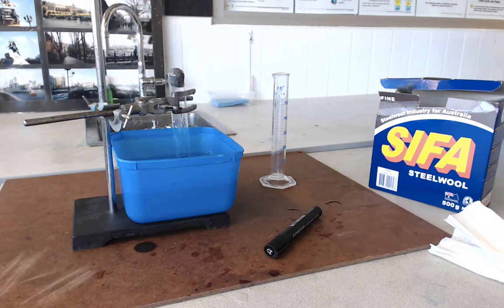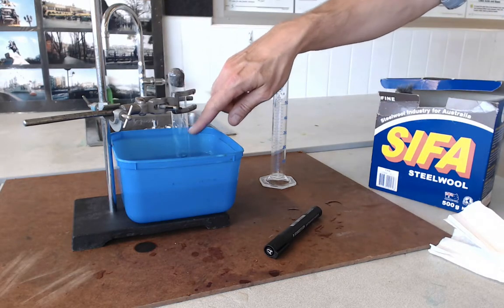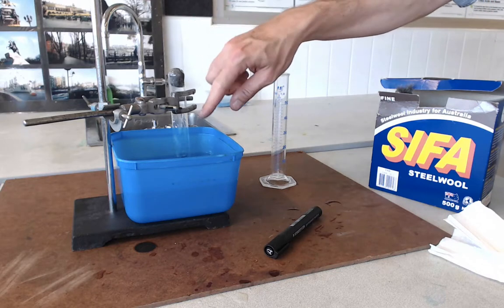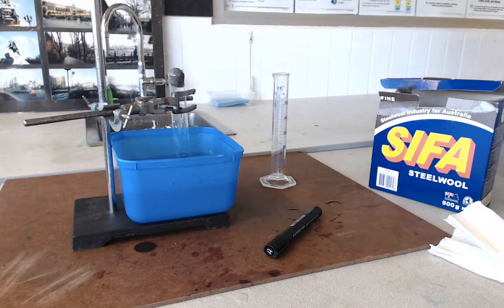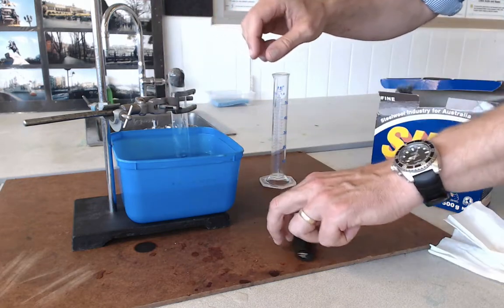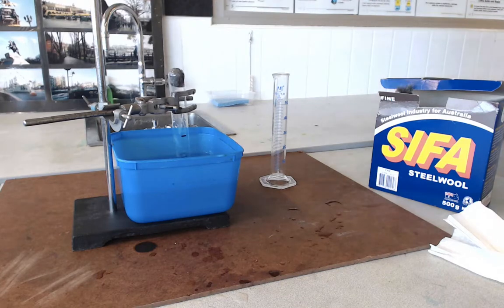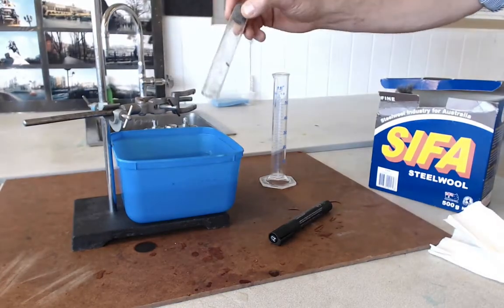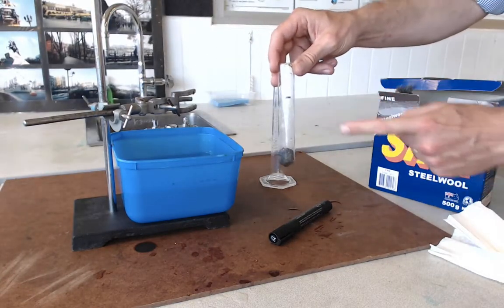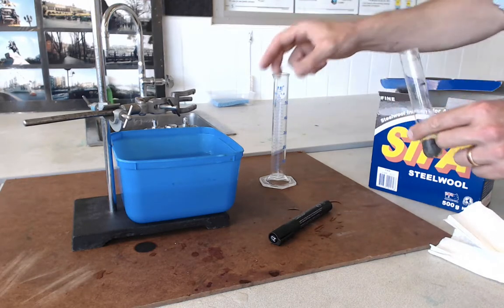When we come back after two or three days, hopefully the combination reaction will have happened. Part of the air inside this tube would have been used up because the iron would have combined with the oxygen in the tube. We're going to try and find out how much oxygen is in the air in that tube. The way we're going to do that is mark the level of the water again, because by now the water will have risen up inside the tube. I'll now have two markings on my tube, and I'm going to find out how much air was used up using this measuring cylinder.